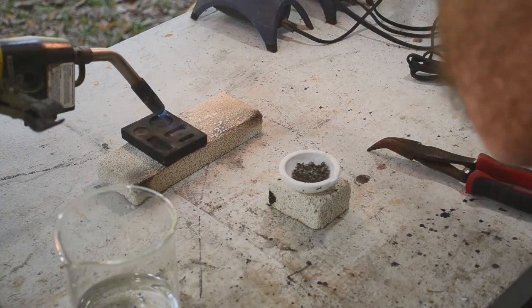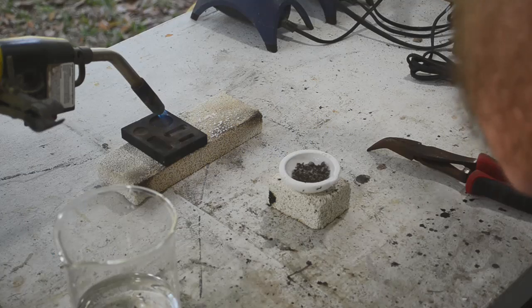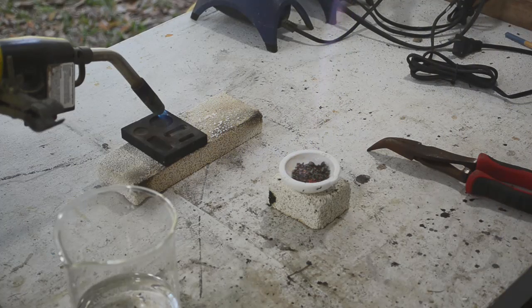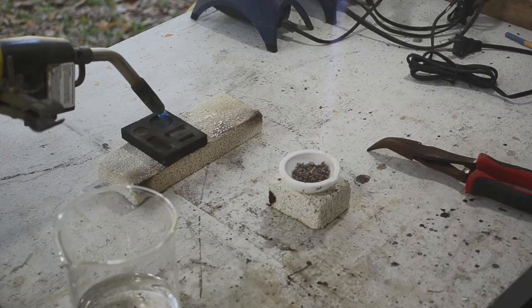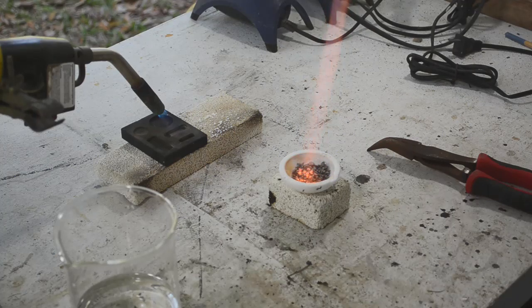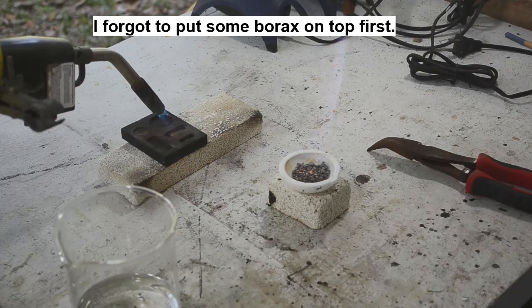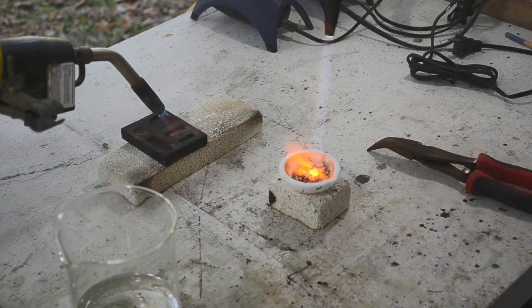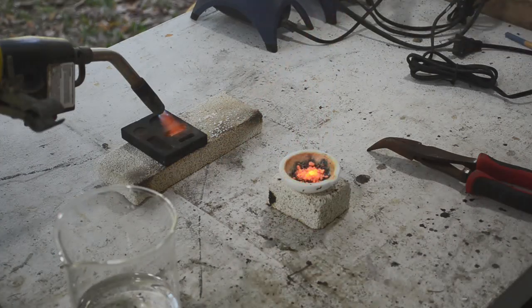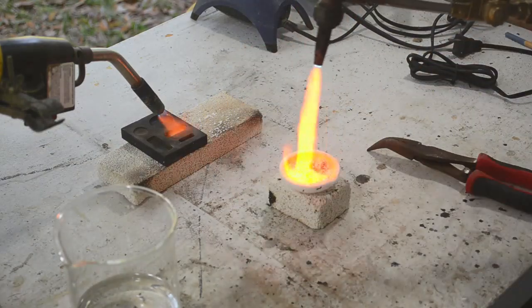Blow flame so I don't blow the silver out all over the place. So I am blowing a few bits out, so we're going to lose a little bit of weight. A little borax.